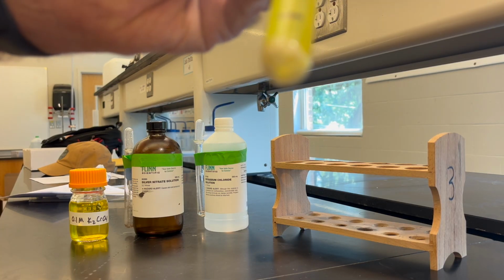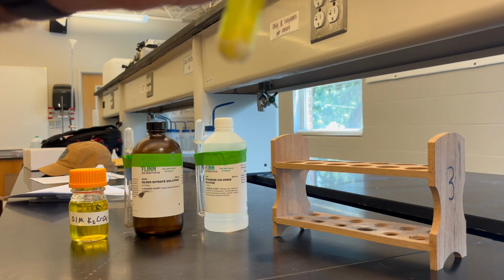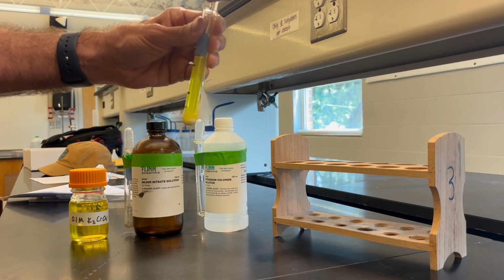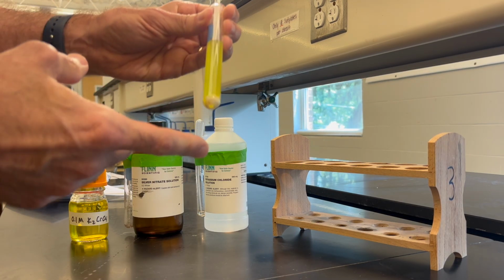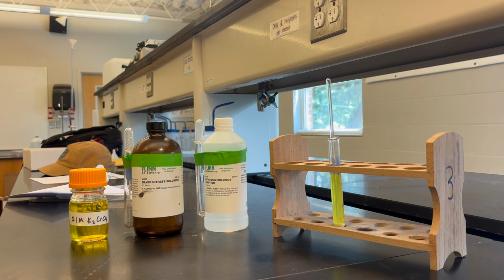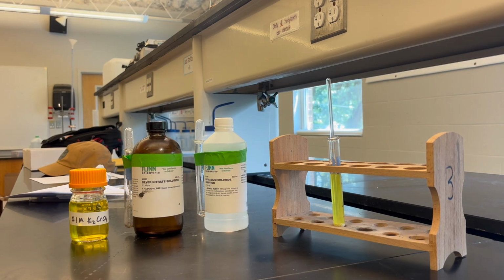And so you can see now that all of that precipitate, or virtually all of it, and if I stir for longer, all of it has magically changed color. And it's a nice quick lab. All right, clearly we've got the yellow of the chromate. We've got the white of a new precipitate forming. And so students can clearly see, practically see the difference, what a difference in KSP means, and perhaps even how to think about solutions that are competing, right? How do we precipitate this ion first versus that ion?